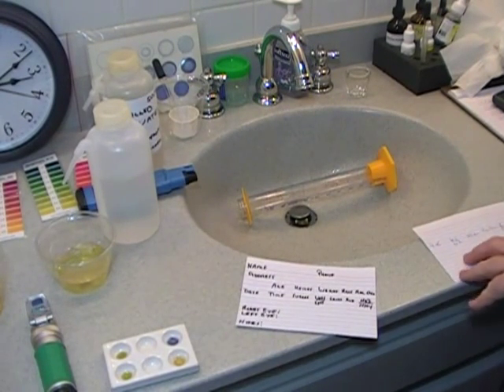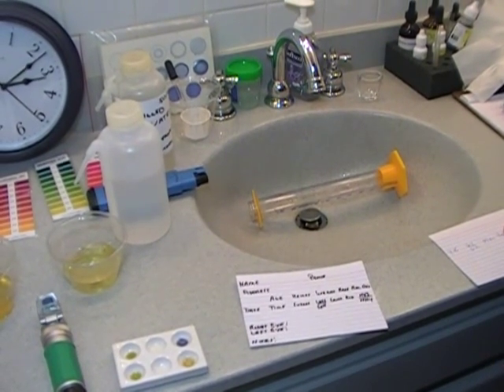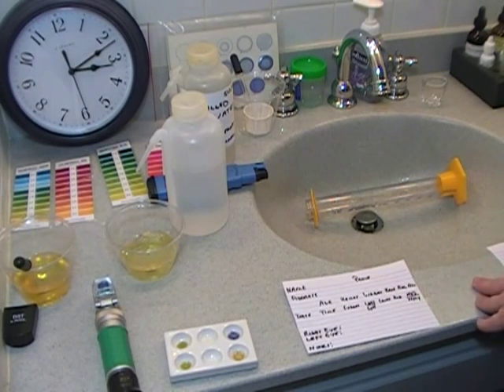And that is the complete urine saliva analysis done in about a little over ten minutes. The reason it took longer than ten minutes is because we had to do the dilution factor. But that's how quickly you can run this test. Thank you very much.